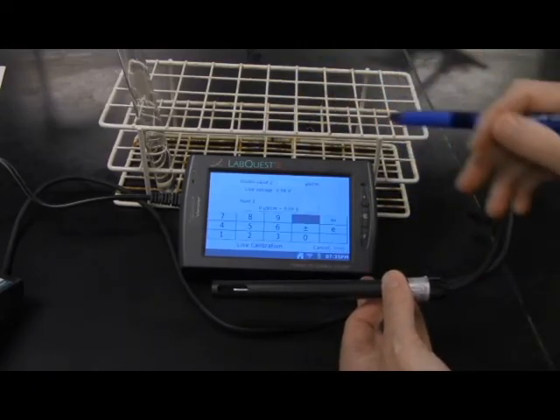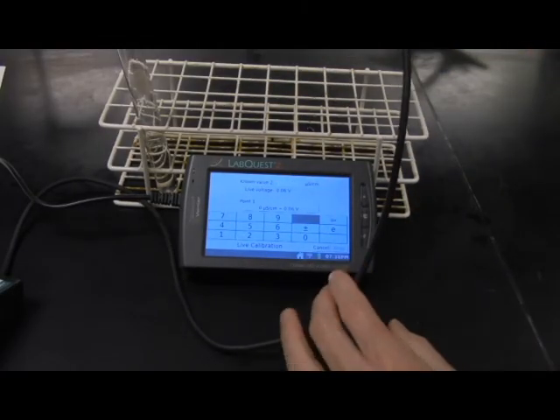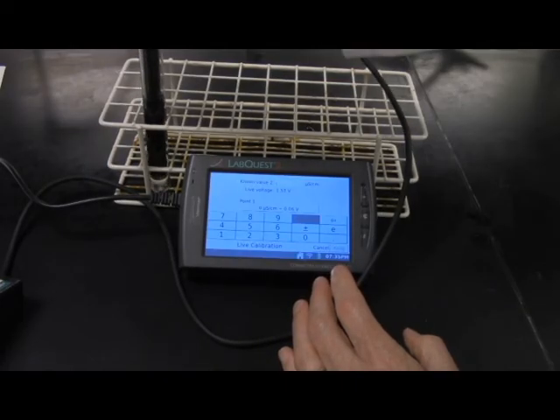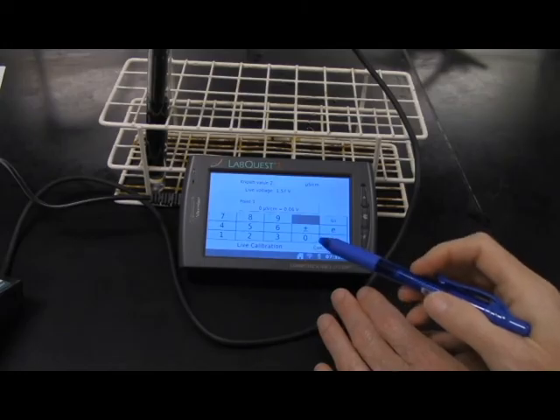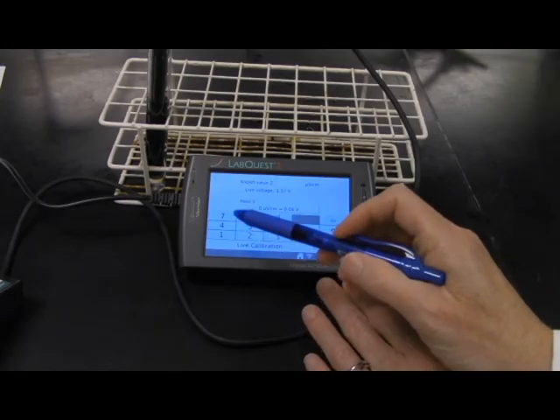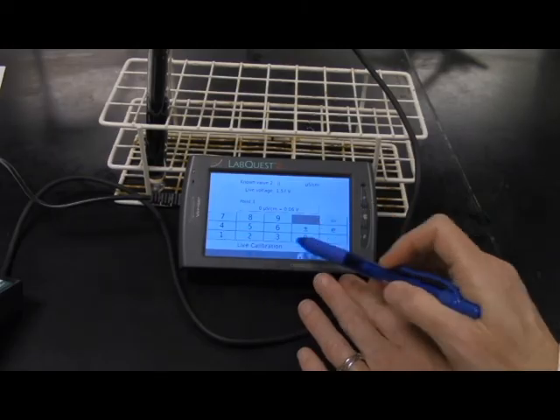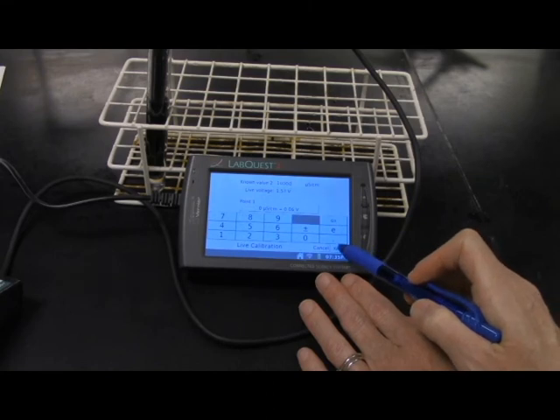And for our known value two, we're going to use a standard solution that we have at the front of the lab. This is a 10,000 microsiemen standard solution. Put it down inside the test tube that has a solution in it. Notice our voltage is changed here. And we're going to tell the probe that we want to call this the 10,000 solution. So we put in 10,000 and keep.